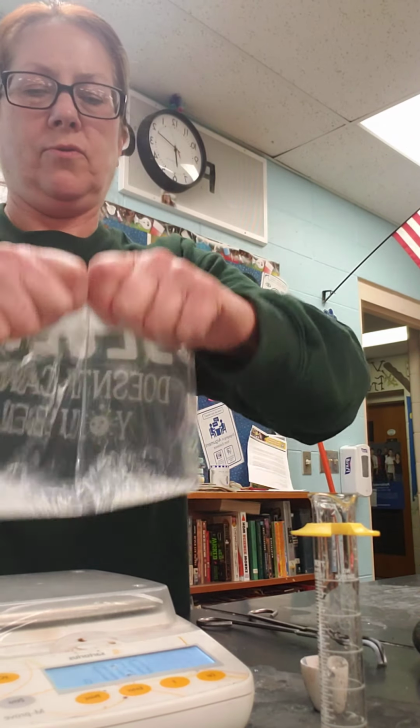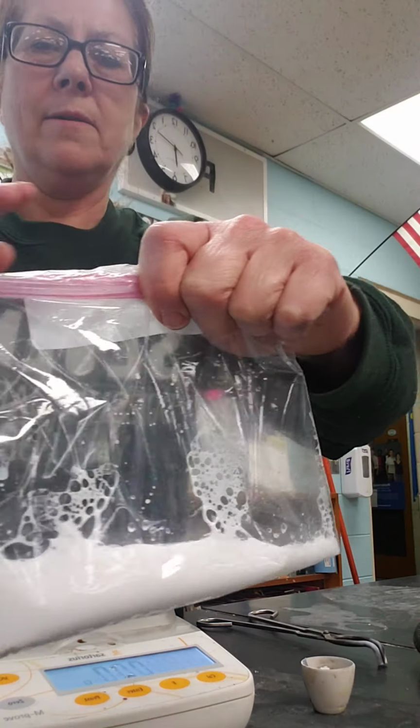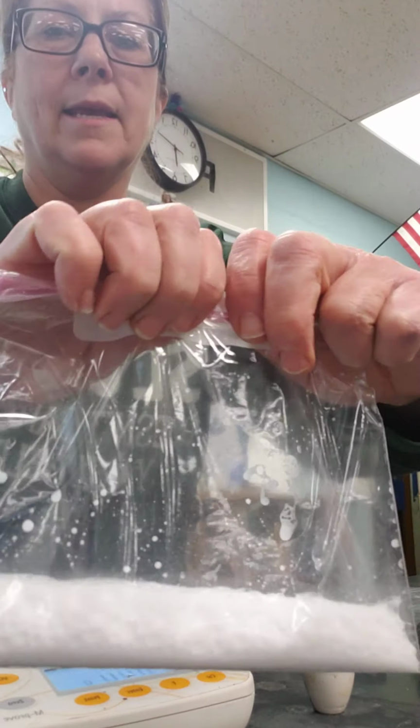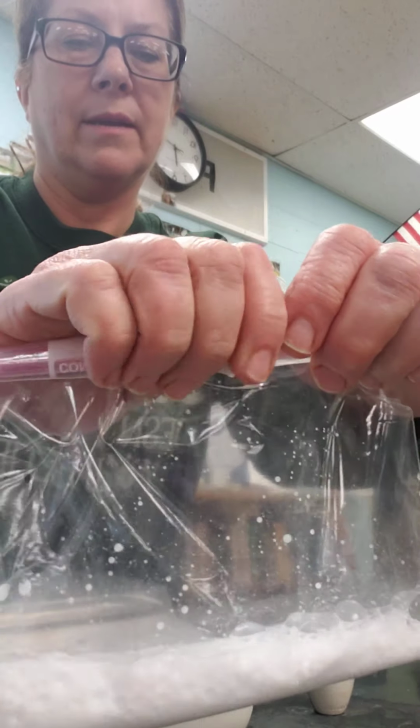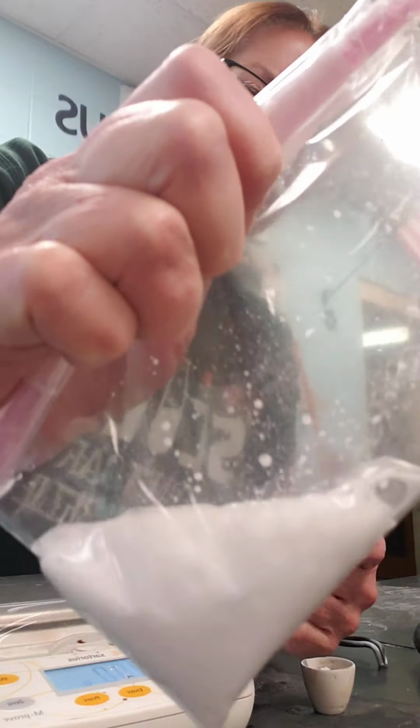Okay, now I'm going to get them all mixed together, and you can't hear this probably, but maybe you can see that I'm producing a gas.